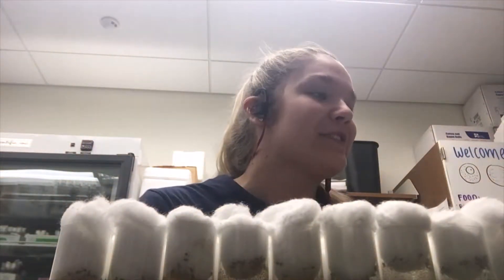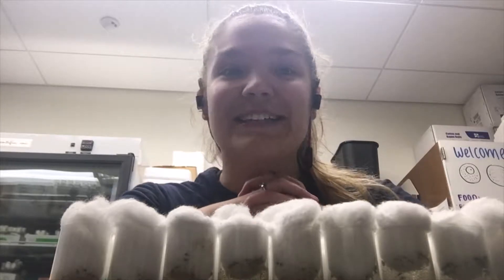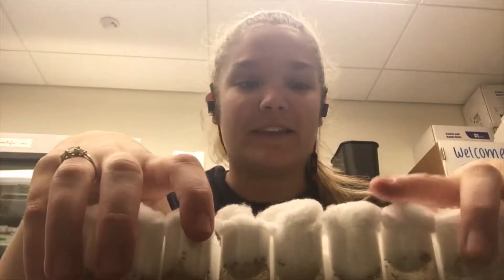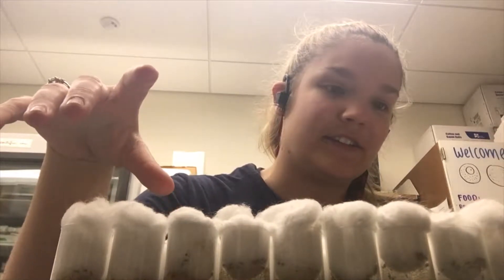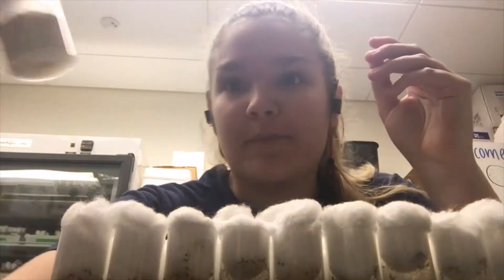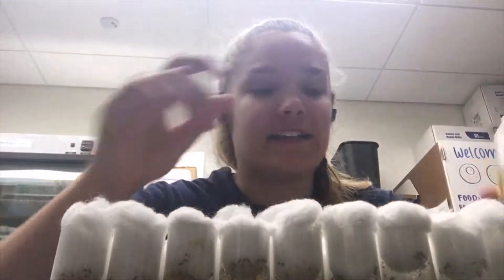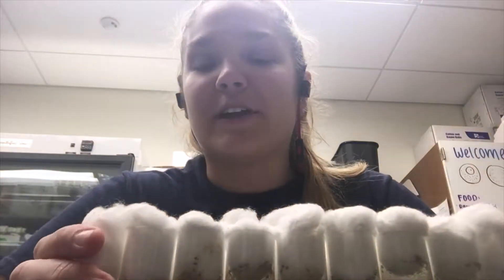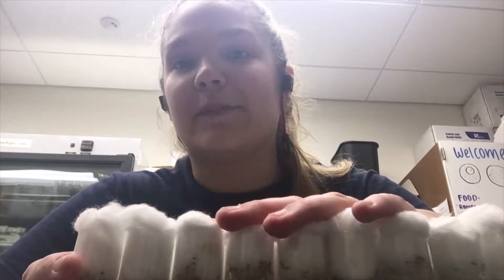I'm here to flip some flies, keep them alive, make sure that everything stays good. I'll show you my lab in a bit after I flip these guys and make sure they're still surviving and thriving. Some of them have mold growing in the bottom so I've got to take care of that. I'll do that first and take a time-lapse so you don't have to sit and watch me flip vials for hours.